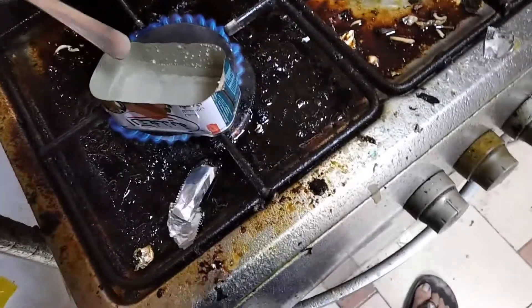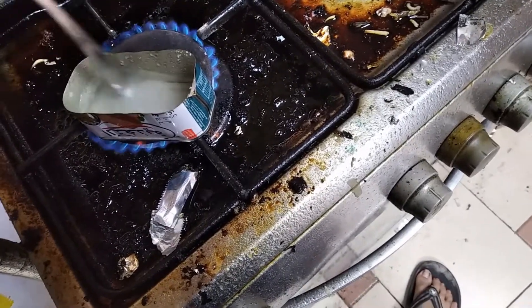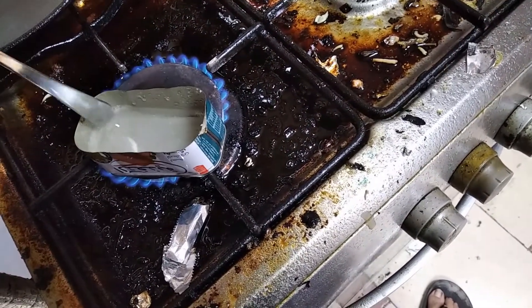I don't really know exactly what it's doing, honestly — it just works. But I think that's what's going on. You just have to let it dissolve. It will not cross-link right away; that's going to be the next step.